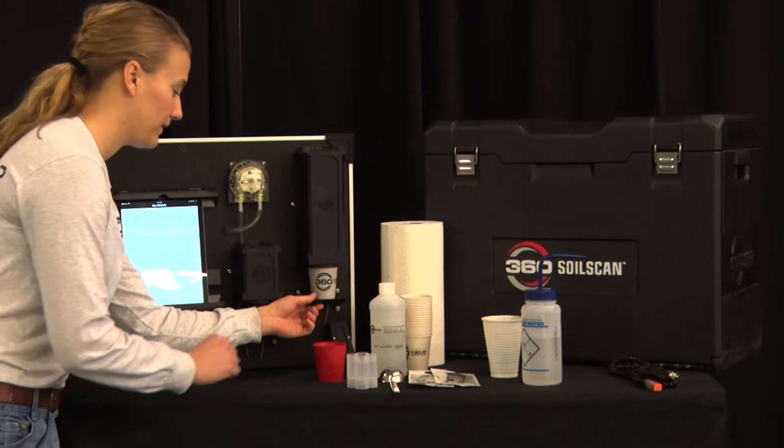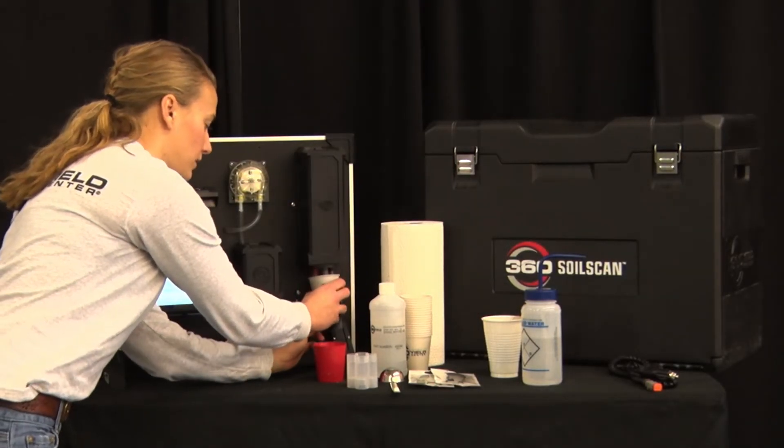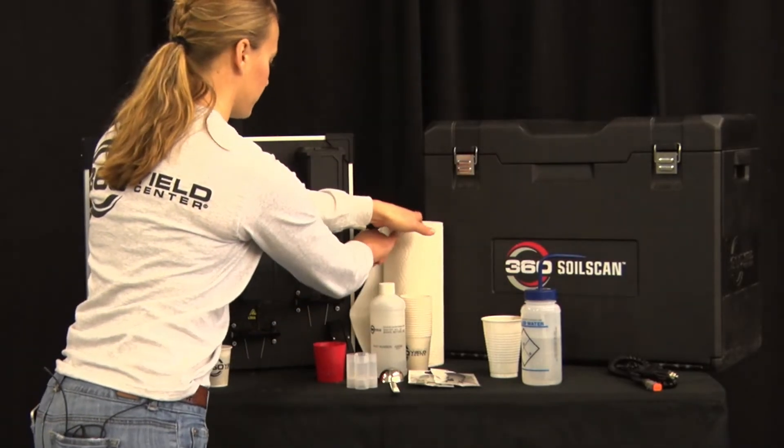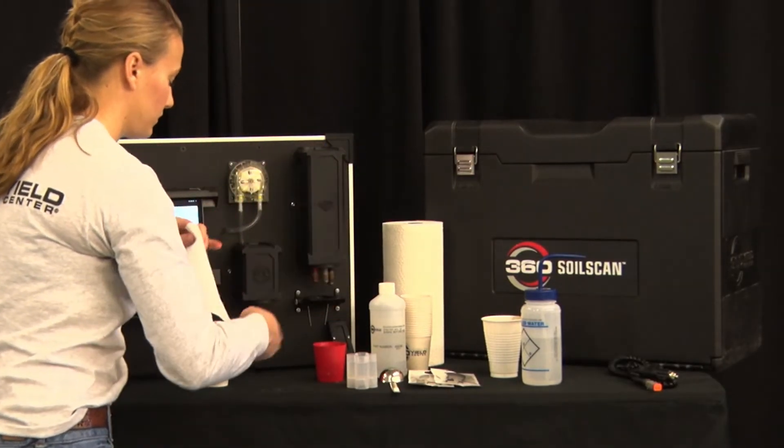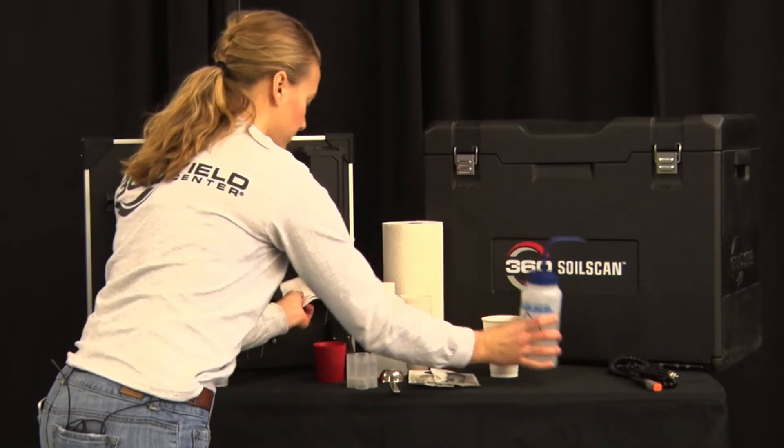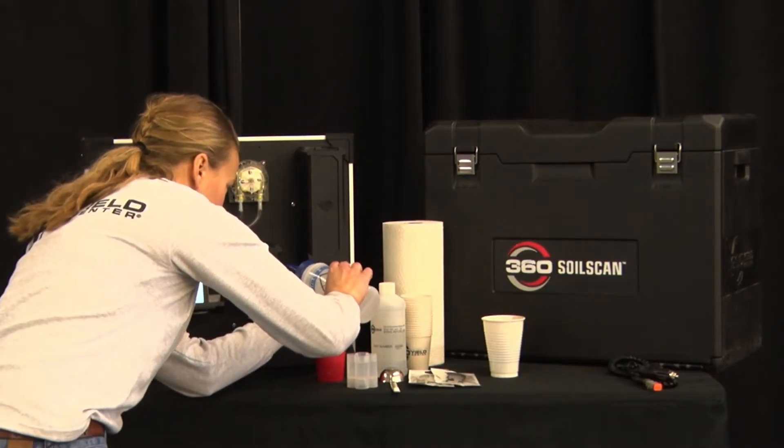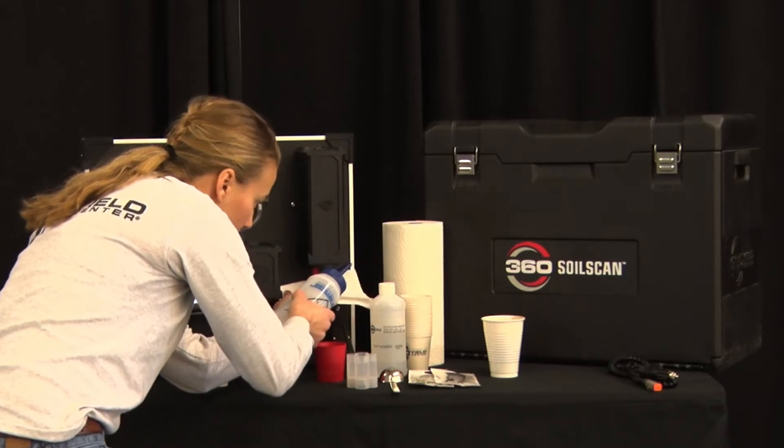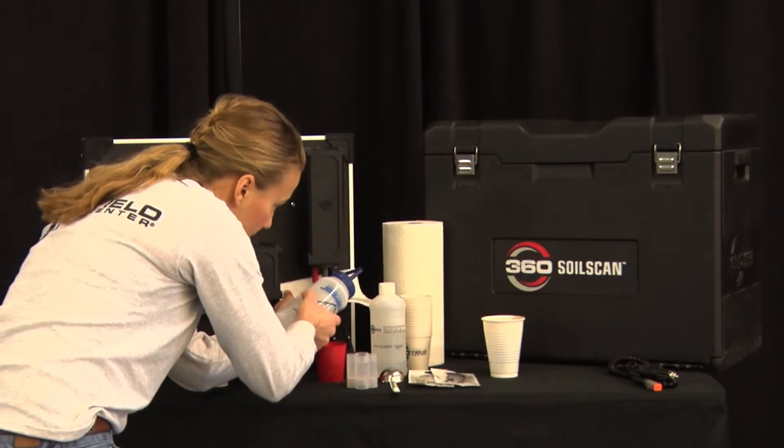After you finish analyzing each soil sample you want to ensure that you clean the sensors very well. Use distilled water and ensure when cleaning the sensors that you only blot. You want to be careful for the sensor tips.